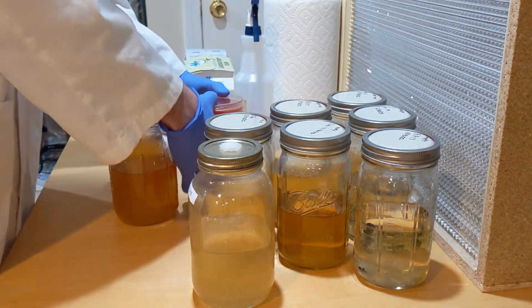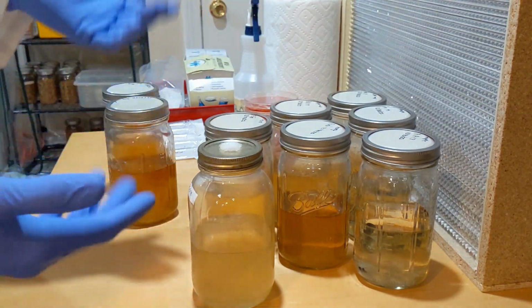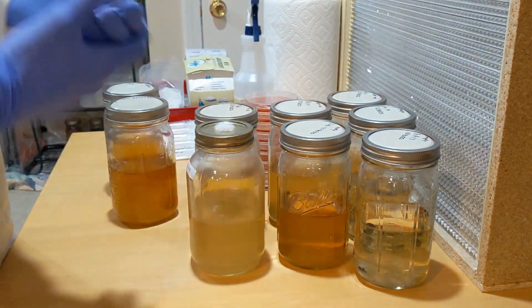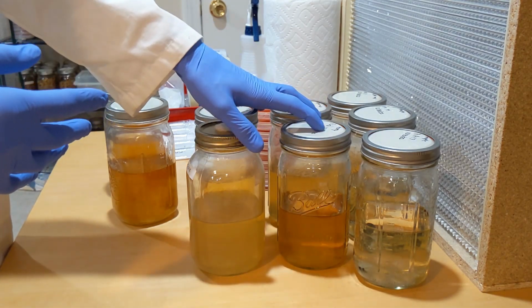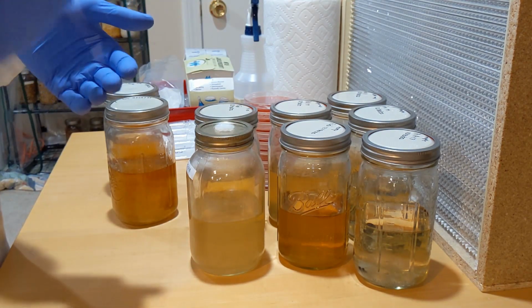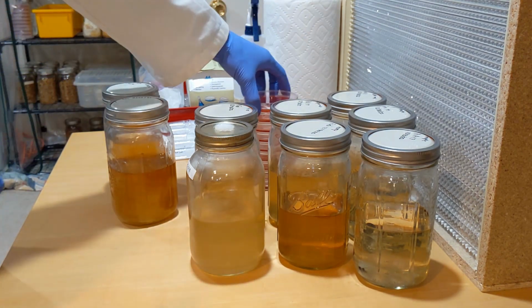And today what I wanna do is make sure they're all clean. It's almost impossible to tell if you have anything contaminated unless you test it on agar afterwards. So it's kind of a process, but it would be a shame to use some of these cultures and inoculate all your jars without knowing if it's contaminated, and then you just wasted a bunch of grains, a bunch of jars, a bunch of time, which is most valuable. So just doing this step is gonna be awesome.